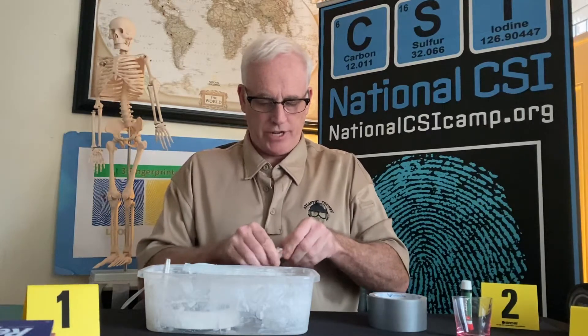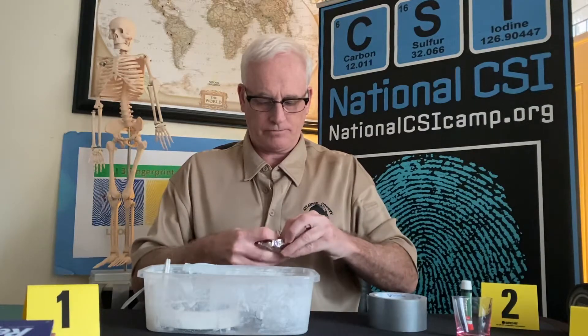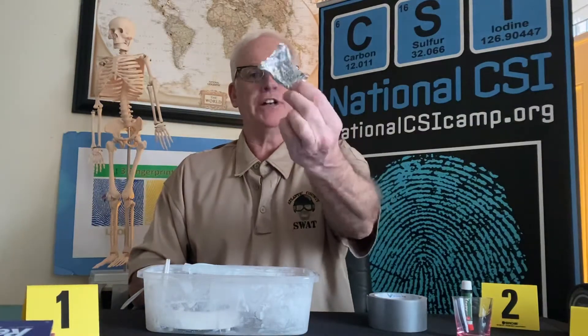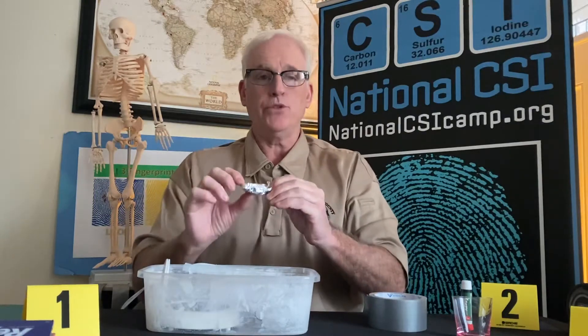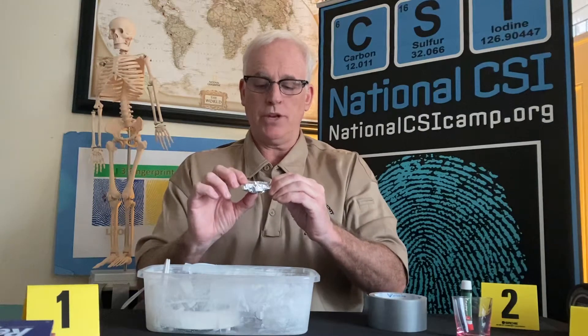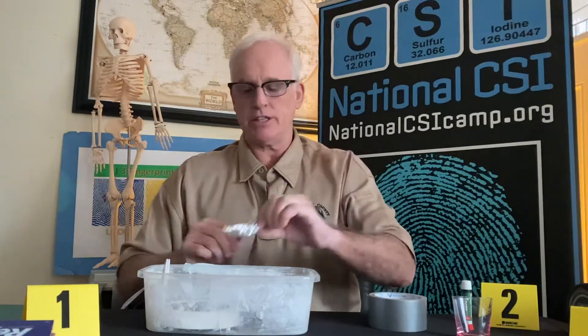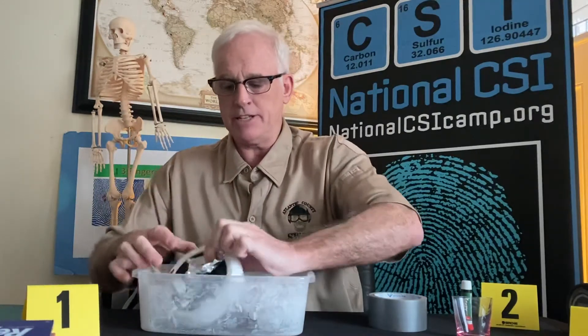This is more functional than anything else, so don't worry about being an origami expert. I've created this very small boat with tin foil, which is going to sit on your heating element. If you have a light bulb as your heat source, make sure the foil is curved in the back so it sits on the bulb itself. We're going to place that piece of tin foil flat, flush up against the heating element.